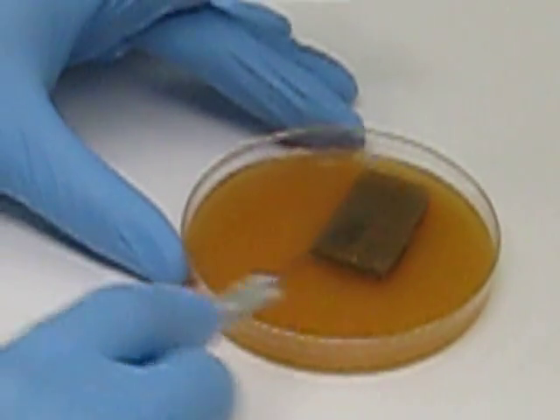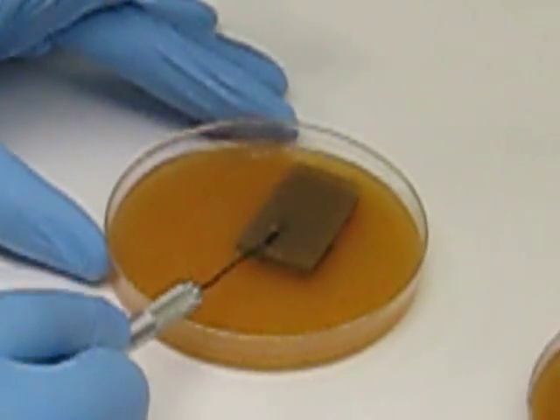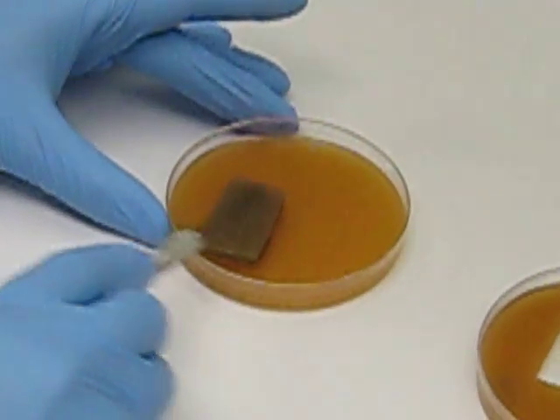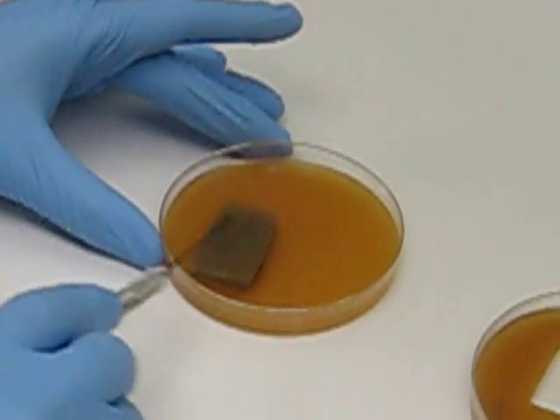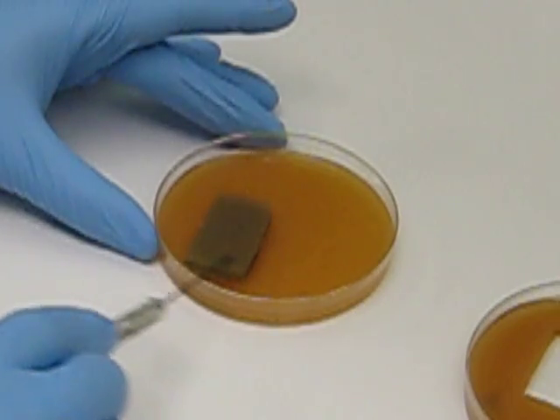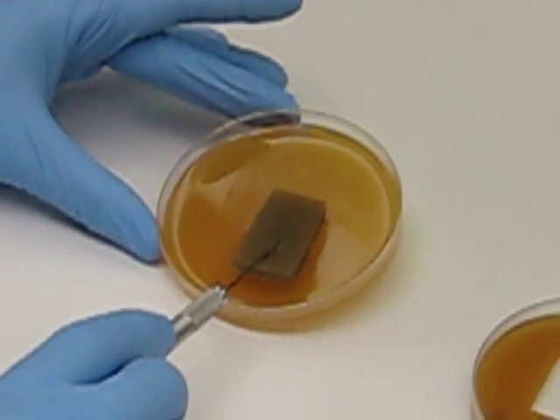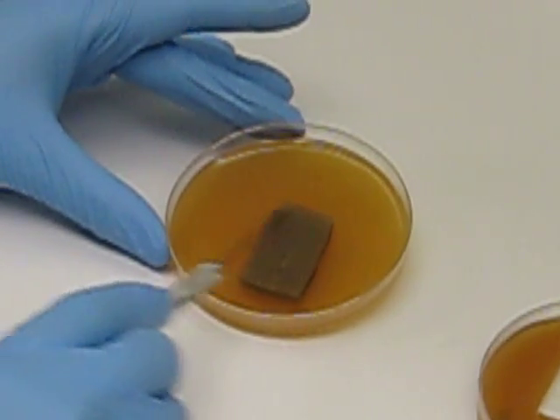Again pat slowly. You can do this up to four or five times per agar chunk like this. After four or five times, there's simply not enough conidia to make a good subculture.